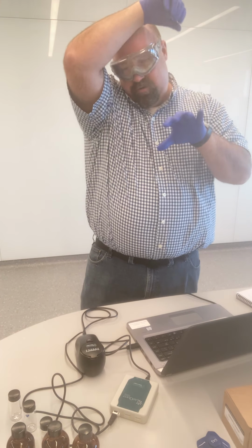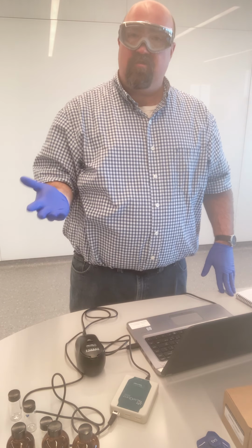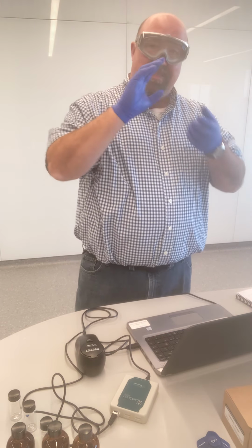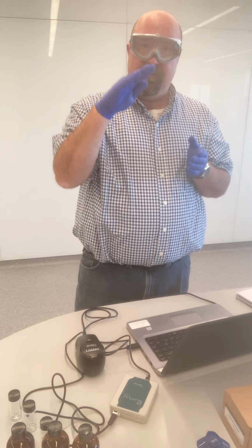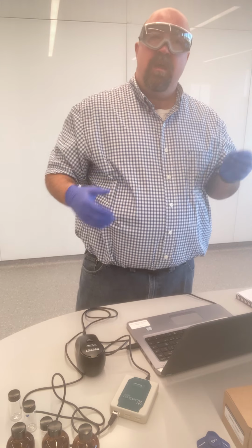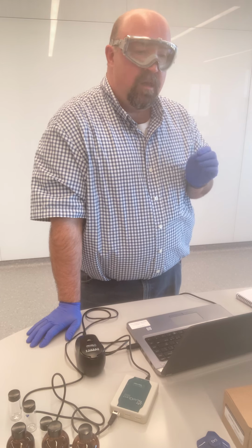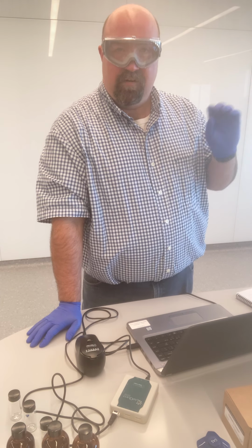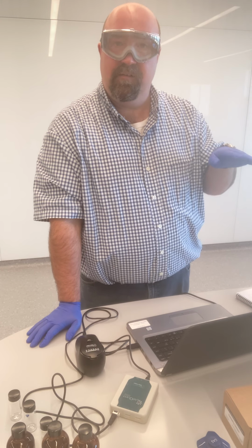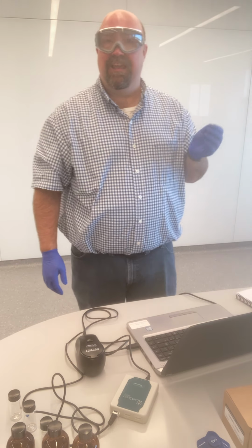And so I'm going to do that same thing for sample spots 2, 3, 4, and 5. I'm going to be getting triplicate measurements of each. As part of your post-lab analysis, what you are going to do is find the average of those 3, that will provide your turbidity reading for sample spot 1. You're then, in order to analyze the precision of this data, going to find the standard deviation and the percent standard deviation, the percent RSD, for that set of triplicate measurements. That will then start to give you an idea for how precise this data set is.